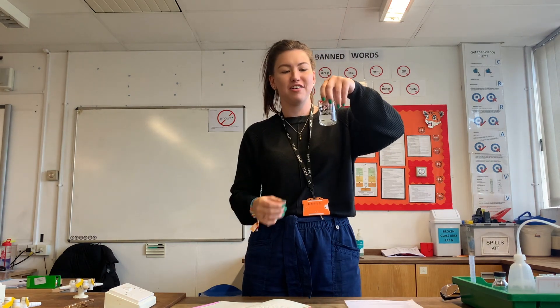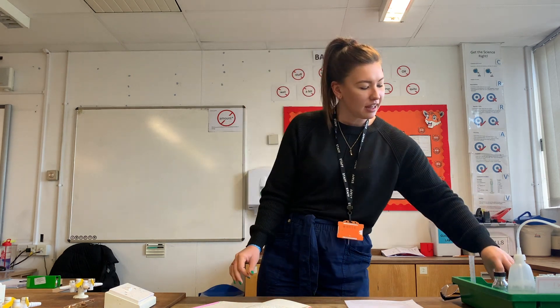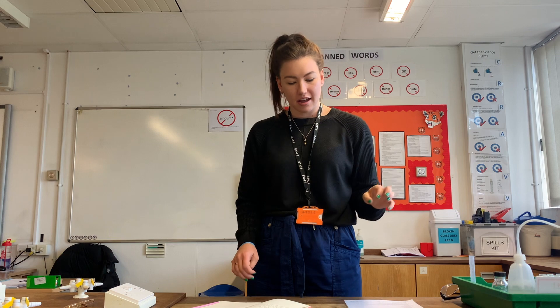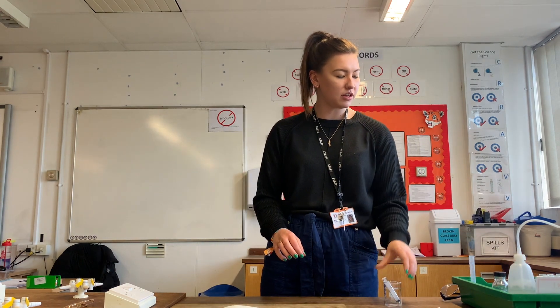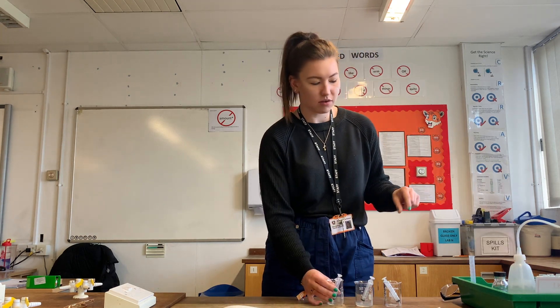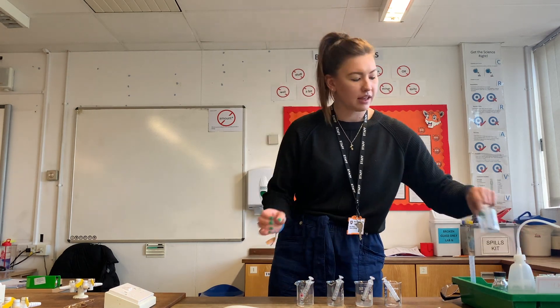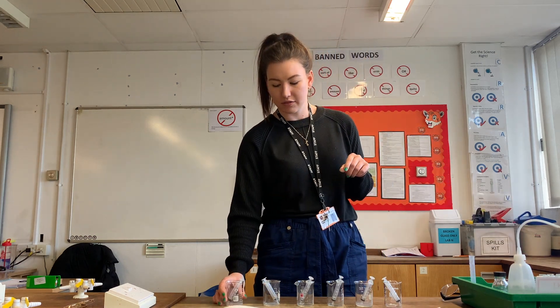Today we are going to do PAG 5.2. We have an unknown concentration of a glucose solution, and the goal of this practical is to figure out what the concentration of that glucose solution is. We will make multiple known glucose solutions by doing a serial dilution, and then we will test the presence of glucose using the Benedict's test for reducing sugars.